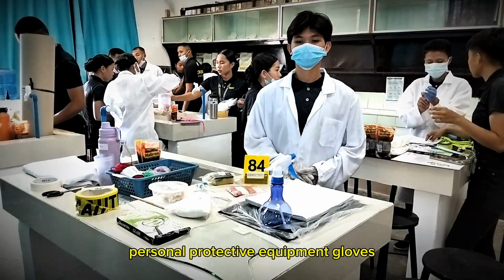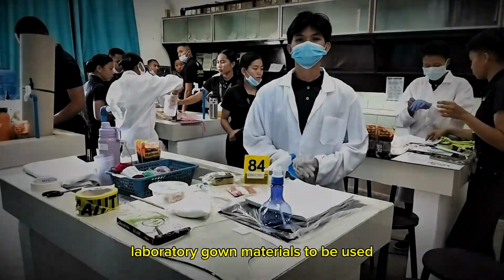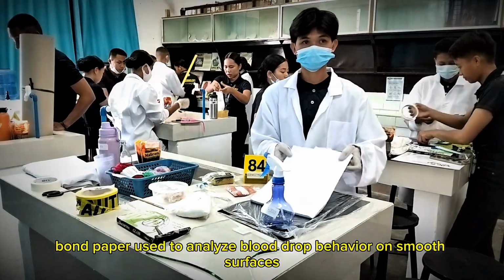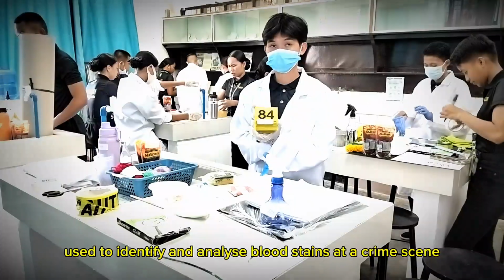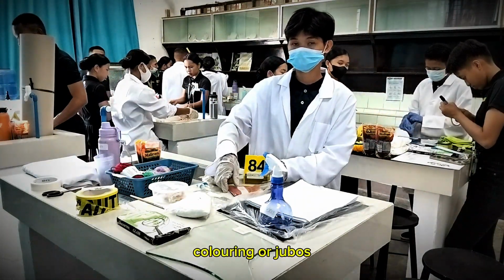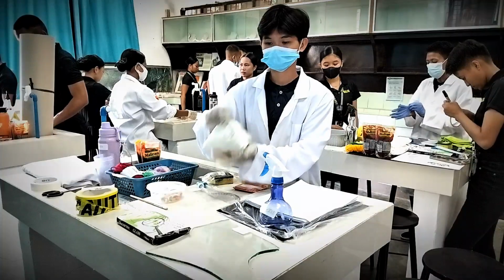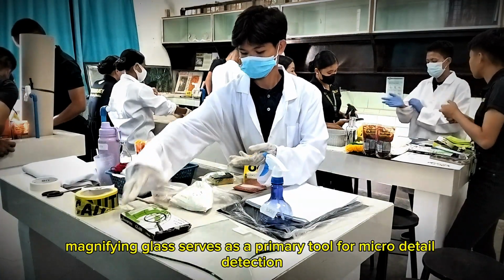Personal protective equipment: gloves, face mask, laboratory gown. Materials to be used: spray bottle; bond paper, used to analyze blood drop behavior on smooth surfaces; evidence stands, used to identify and analyze blood stains at a crime scene; coloring; protractor, used to measure the impact angle of blood stains; cornstarch; magnifying glass, serves as a primary tool for micro-detail detection.